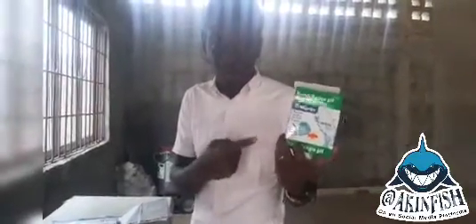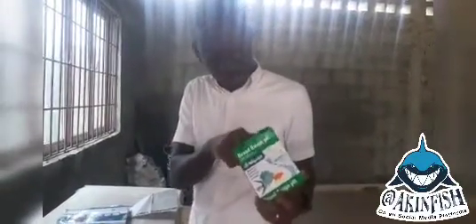So with this, you can also test for other water parameters, because this depends on whether you are using it for a fish farm or a poultry. The last video I shared with you was on a fish farm. And if you say, oh okay, you know that all those other things are perfect, this here is a test kit for only water pH, all right? So this is the one that uses a drop.